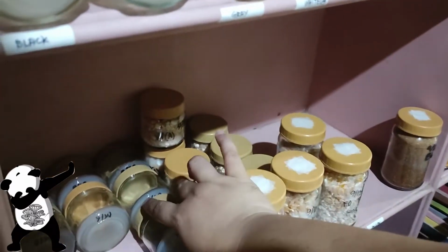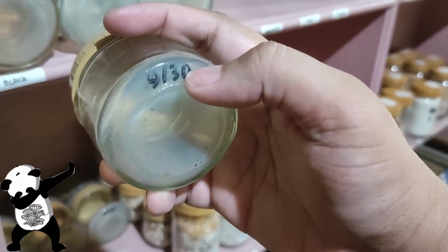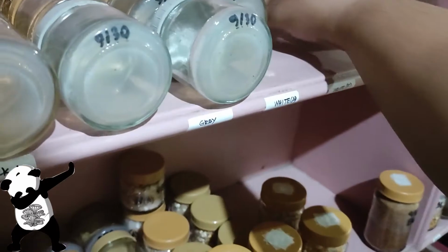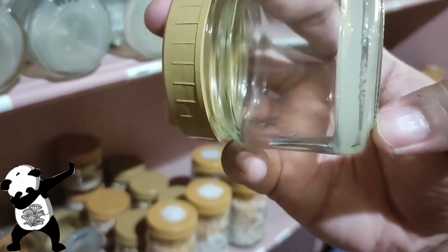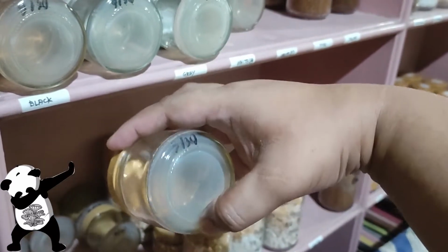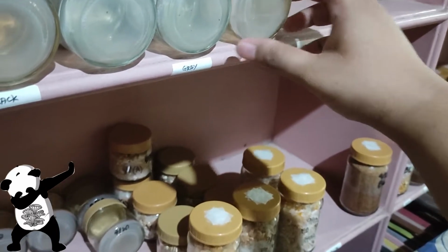So yeah, it seems like everything's clean, but we still have 7 plates to go, and the black spots are actually paints or possible even the ink from the previous label. But most of them, the one that I'm having hard to remove, are the paint that was attached to the glass, but it's not contamination. So yeah, as you can see, it's really clean. So I have it sideways so that the moisture will be on the side, but after inoculation I'm gonna put it upside down, just like the usual setup that I have. So yeah, seems clean.